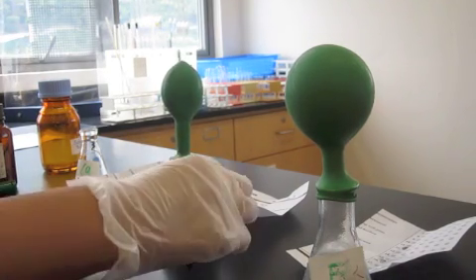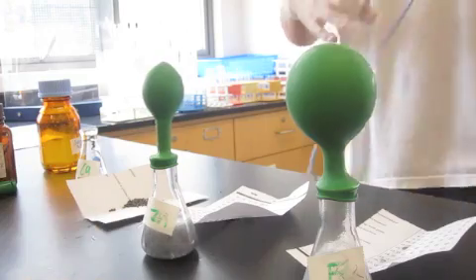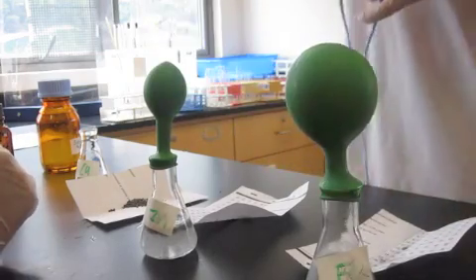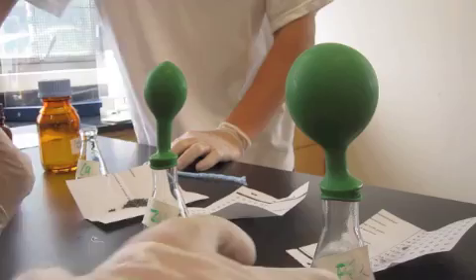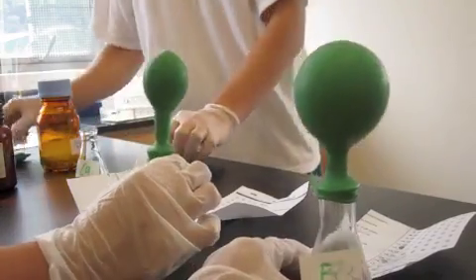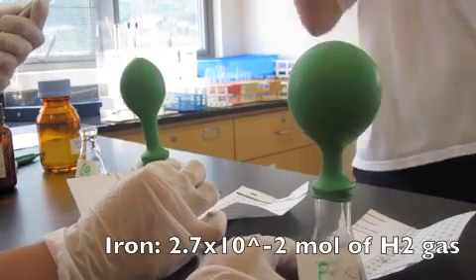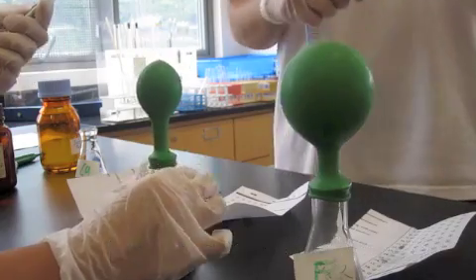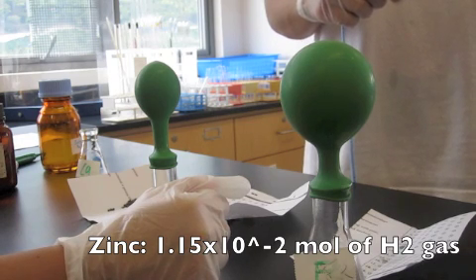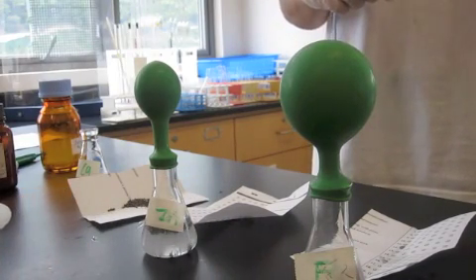Throughout the whole experiment, we saw that iron had the biggest balloon in circumference. This held true to our calculations, although calcium should have produced the most moles of H2 gas. Iron was the second most moles of H2 gas, and the reason why calcium didn't react was because it was put in pellets. Iron released 2.7 times 10 to the negative second moles of H2 gas, and zinc released 1.15 times 10 to the negative second moles of H2 gas. So that's why the zinc balloon was just a bit smaller than the iron balloon in the end.